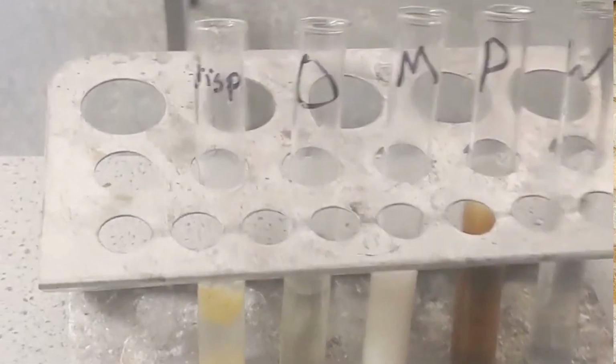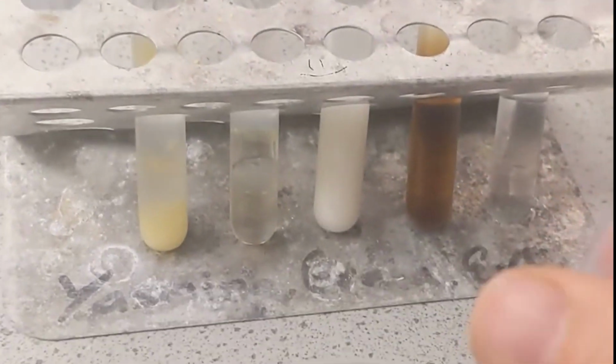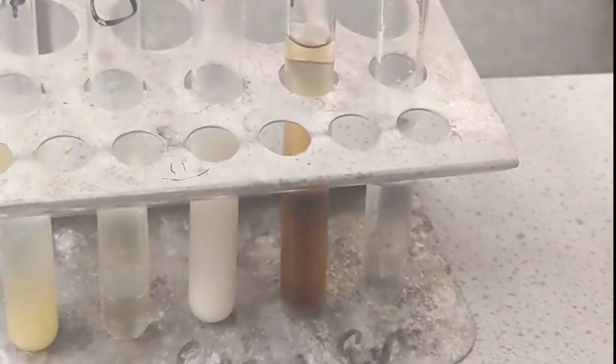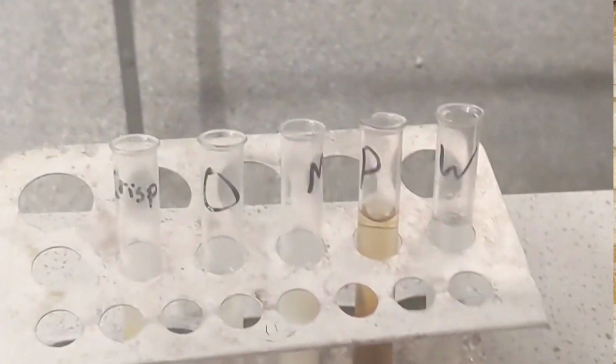I need to add a little bit of water as well to this one so that way I can create a barrier, create a little bit of separation. When I swirl them together, if there's nothing present, I'm not going to see anything happen. It's just going to stay as it is. It's going to be a clear solution. But if there is lipids present, I'll start to see this little cloudy layer right here at the top form, that precipitate. That's telling me that there is a lipid present in that substance.